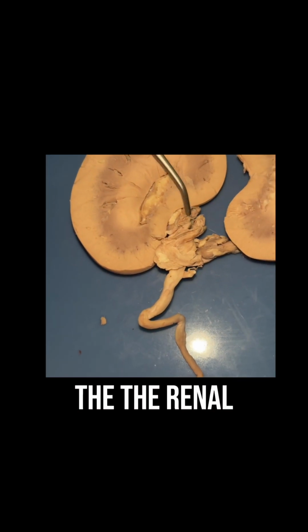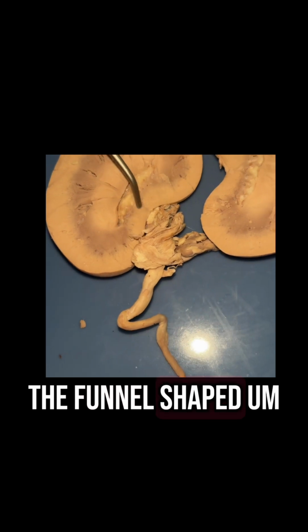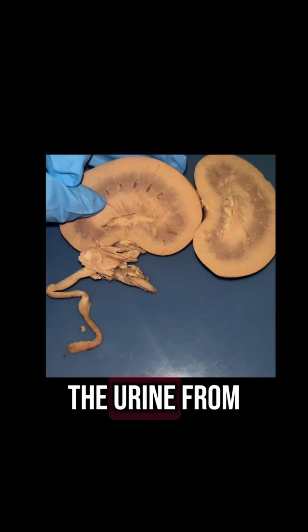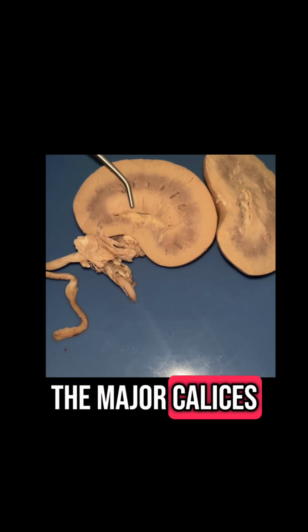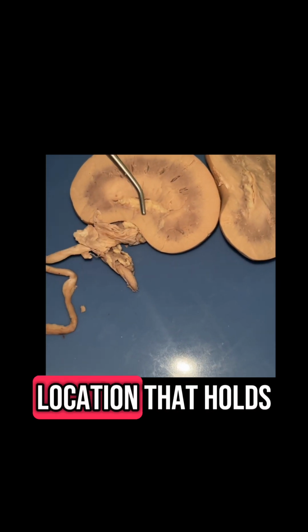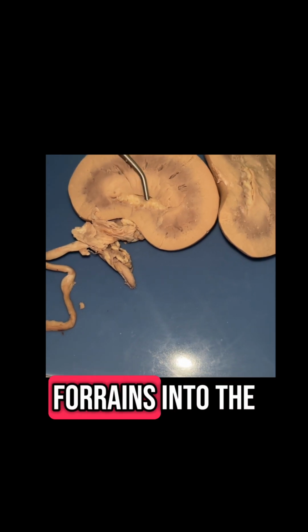Okay, next we have the renal pelvis here. It's going to be the funnel-shaped place inside of this kidney, and it's going to collect all of the urine from the major calyxes. And it also is the location that holds all of the urine before it drains into the ureter.